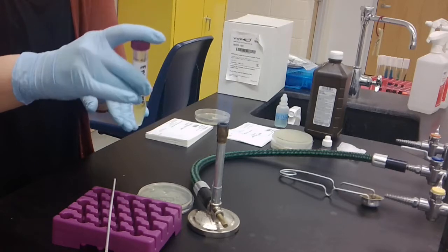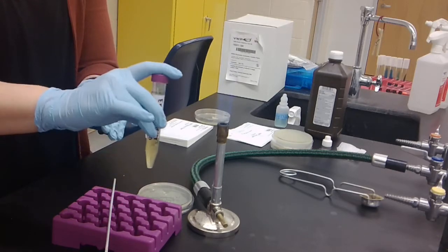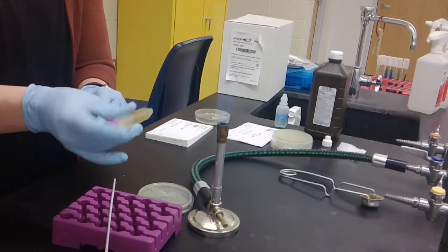Bacteria tend to settle to the bottom of a broth culture, so you want to make sure that you invert the culture to evenly distribute your bacteria.